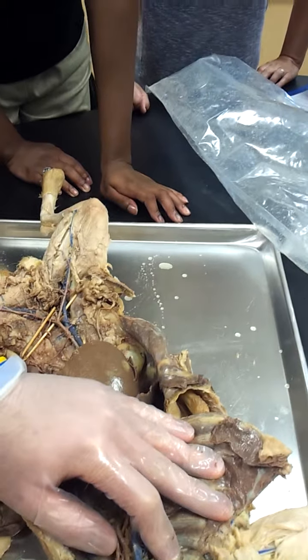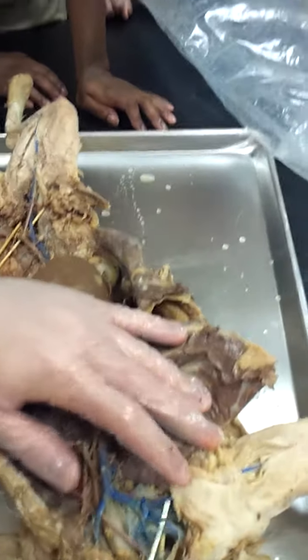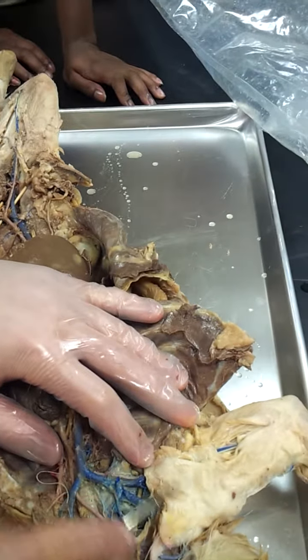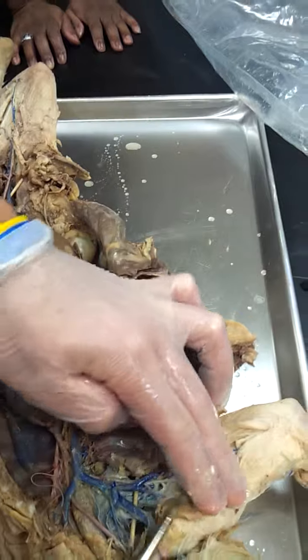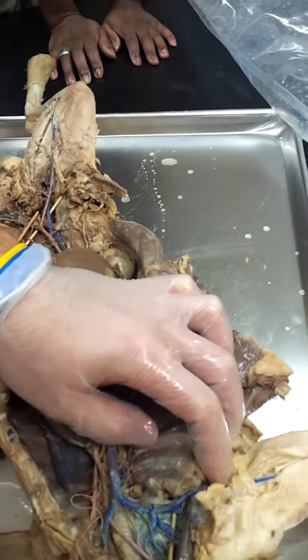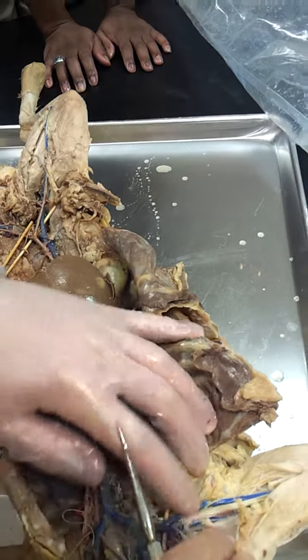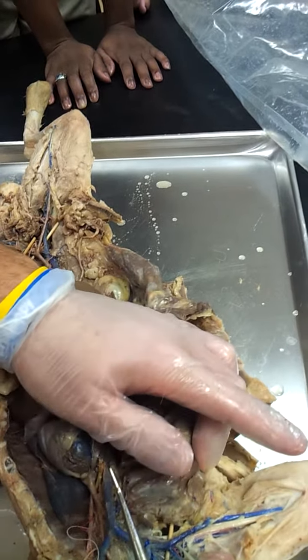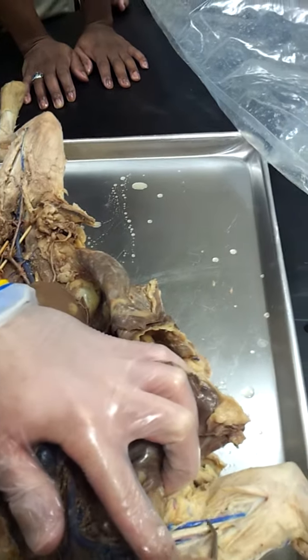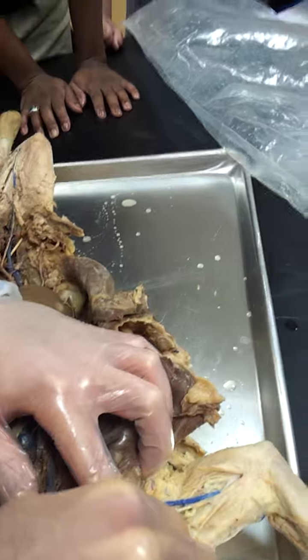So if we flip that piece of tissue down, you can kind of see how the shoulder region begins here. So we'd go from subclavian to the next area, which would be axillary. And then we would go from axillary towards that bicep region, which would be the brachial. And these are all veins or arteries? The blue is the vein. The artery is tucked underneath here.